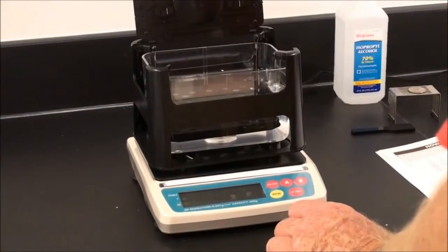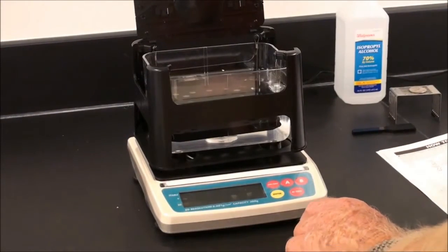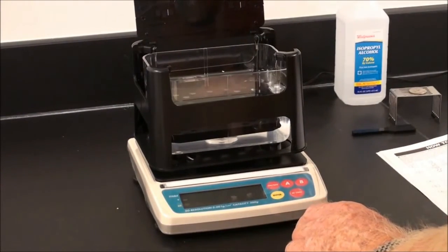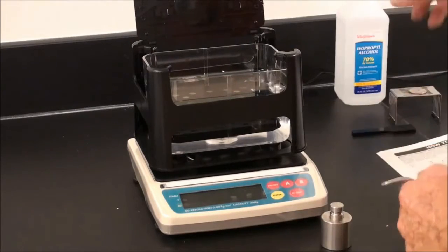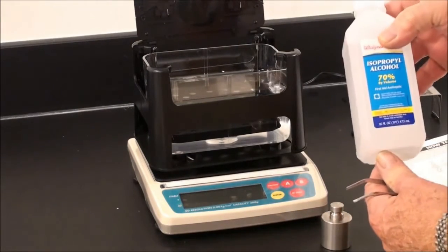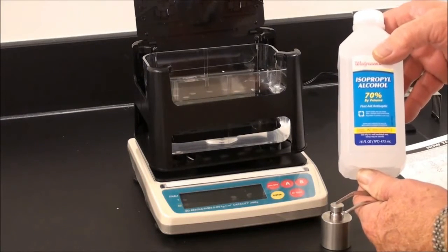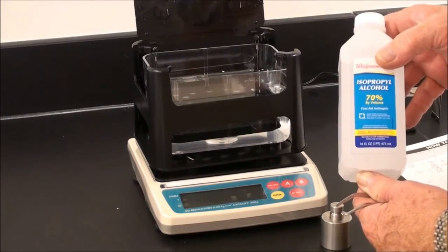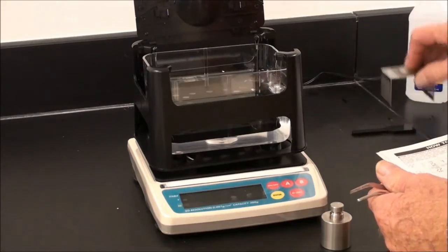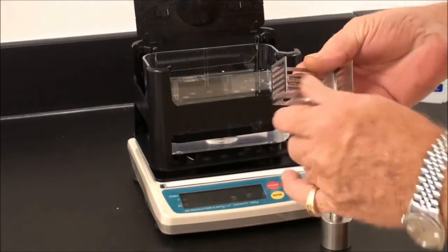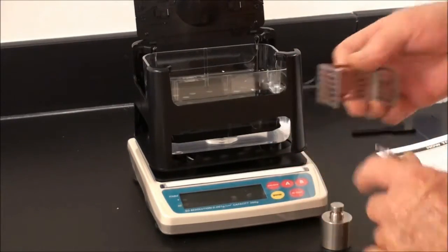To perform a calibration, it's very easy. Fill the tank with water and we suggest adding a few milliliters of isopropanol or ethanol. This helps prevent formation of bubbles underneath the weighing stage and the samples, which results in unwanted buoyancy.